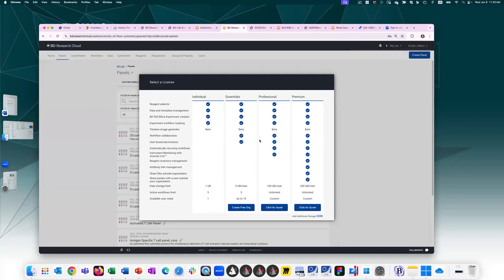You can also create an essentials free organization that comes with a few additional features and a bit more data as well. So these two are completely free, and you can create your panel, you can create DIVA experiments, you can create populations. So you can really do a lot with the essentials, but for the professional and premium, the additional paid for features are the instrument monitoring with Assurity Linc. So if you have a BD instrument that is monitored by RSS remotely, you can view your QC reports directly in BDRC. So that only comes with the professional license.